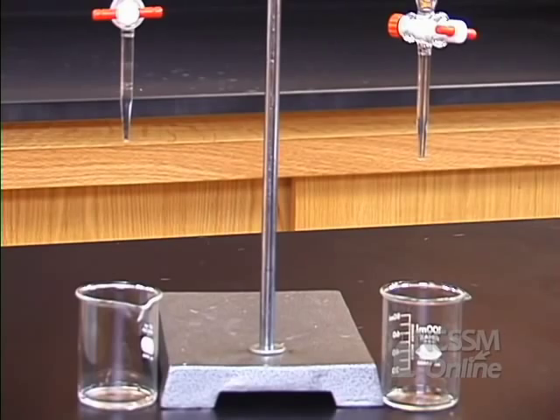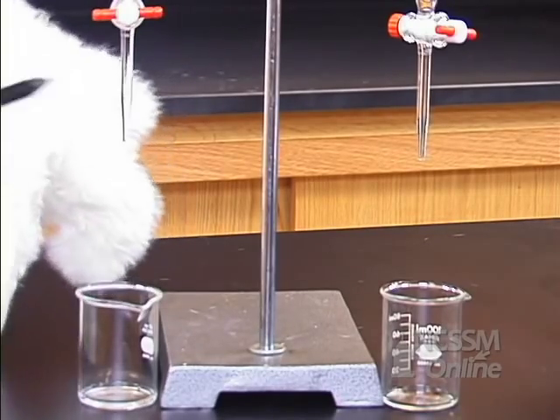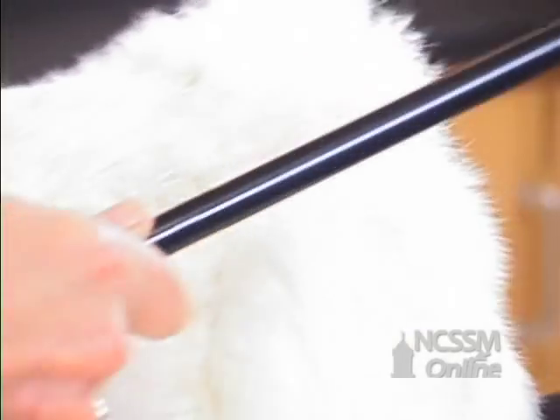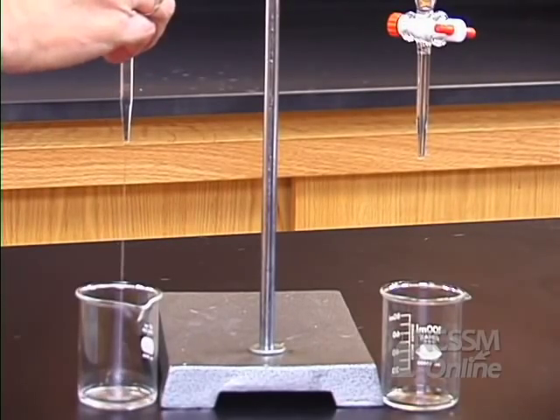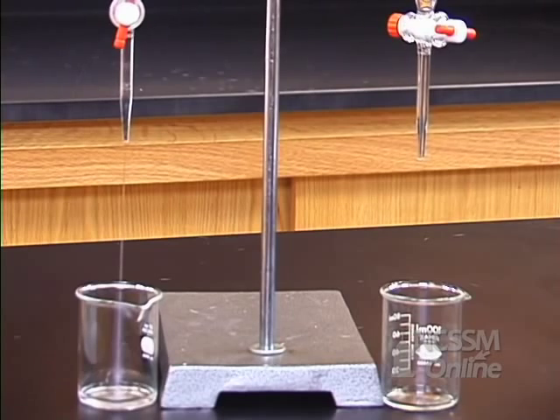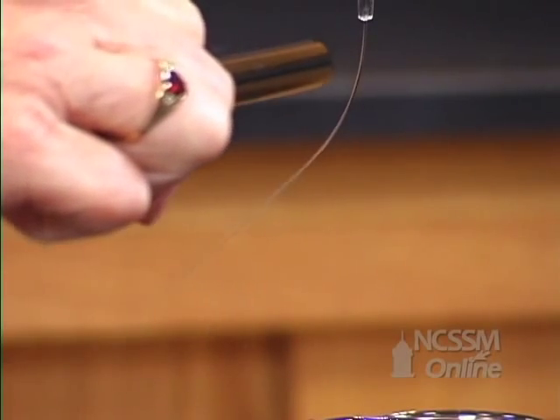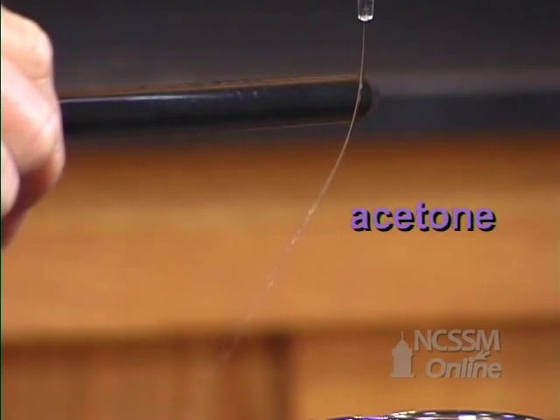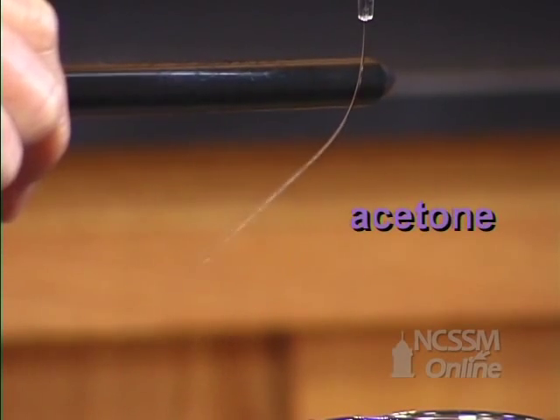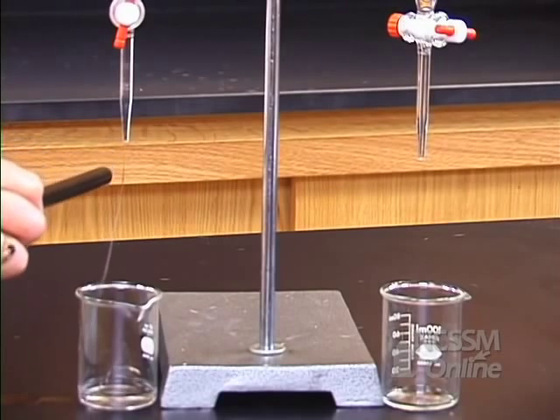Let's first look at acetone. We're going to use our ebonite rod and our rabbit's fur to collect a charge again. We're going to have our stream, and you can see that it definitely bends the acetone, so it is a polar molecule.